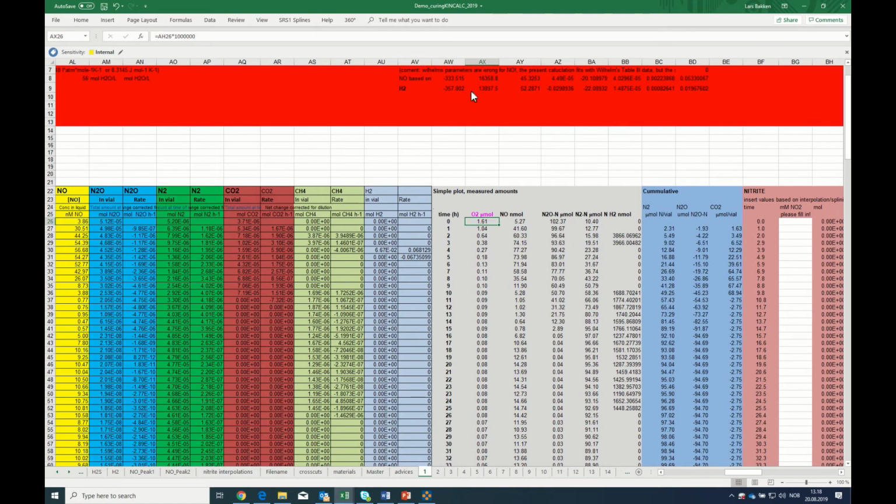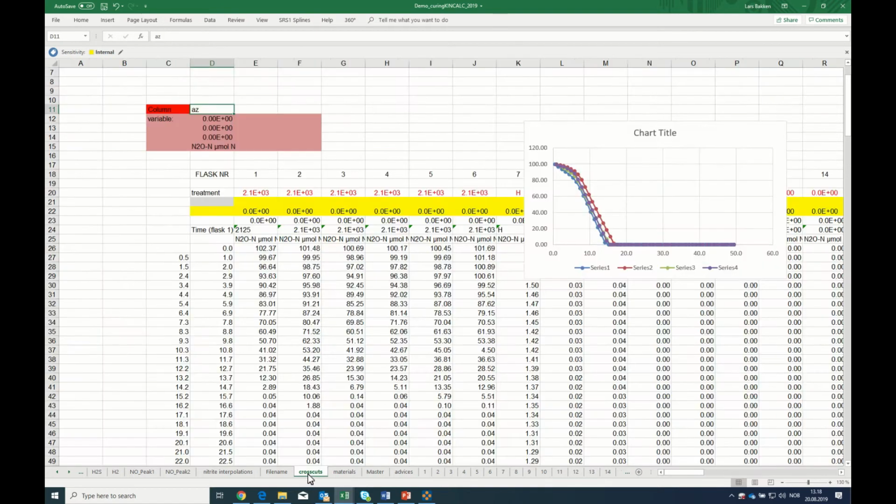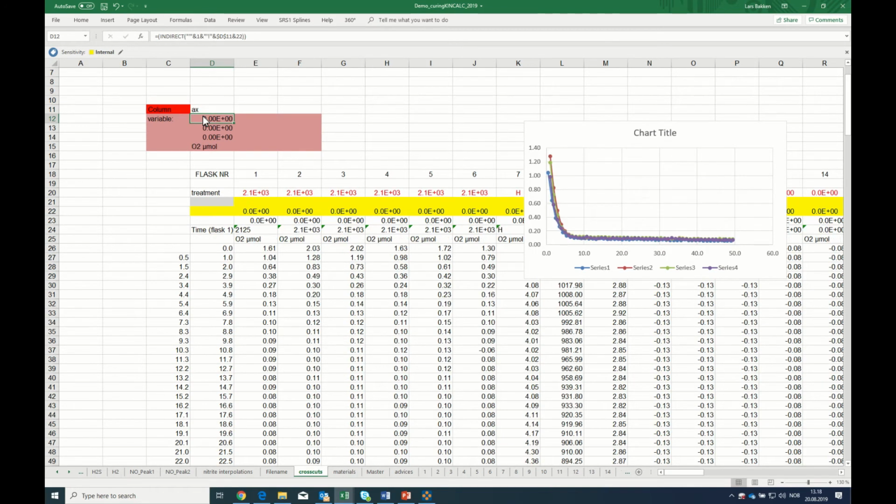So we can plot a column AX. And it looks quite nice. They deplete the oxygen within the first 5 hours, and then we have almost zero oxygen at the end.